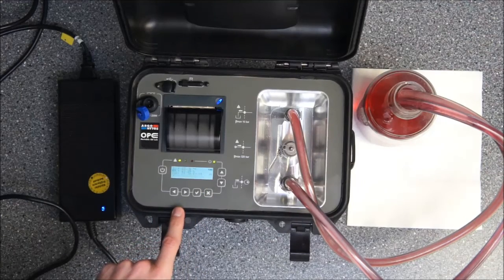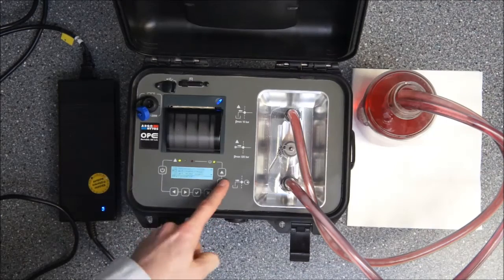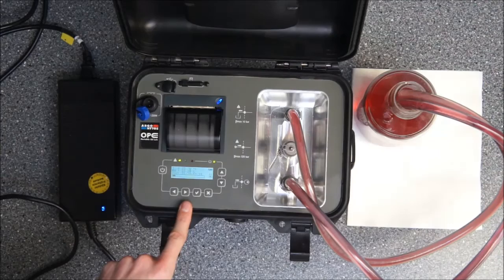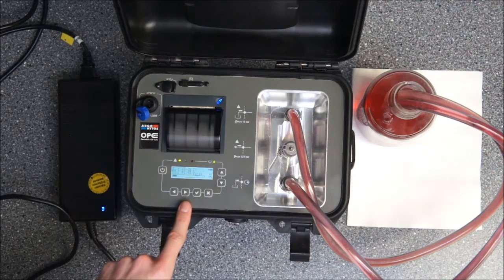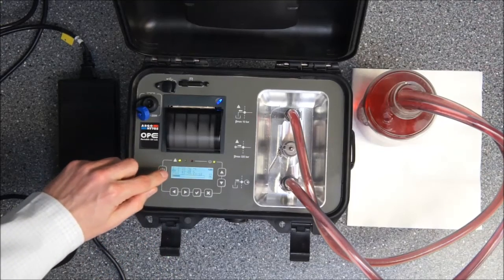After the progress bar is at 100% you see the first measurement. We will take another one just to show repetitively how it is done. It's pretty easy, just pushing two times the button and you have the current oil quality. The results of the last measurement are on top of it.